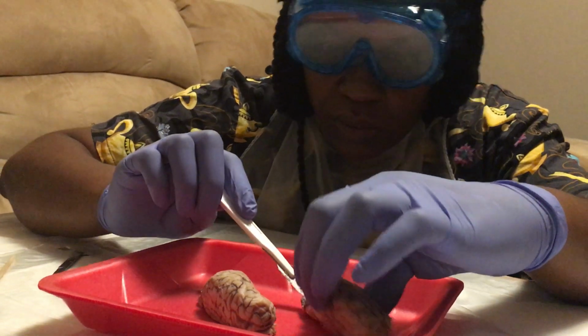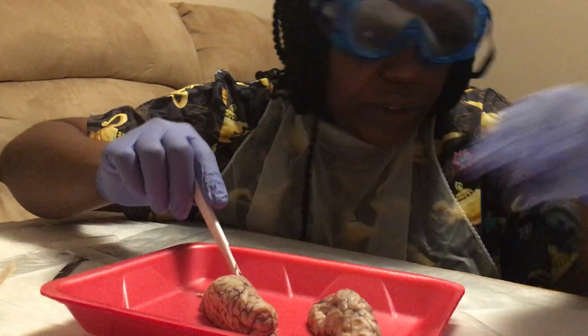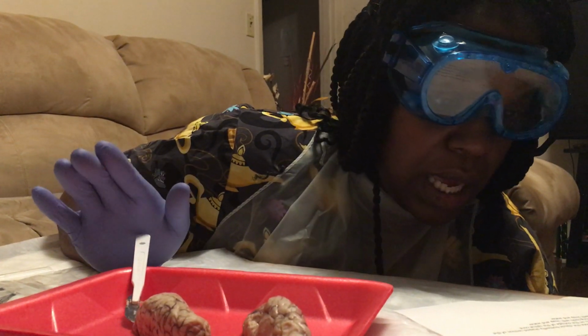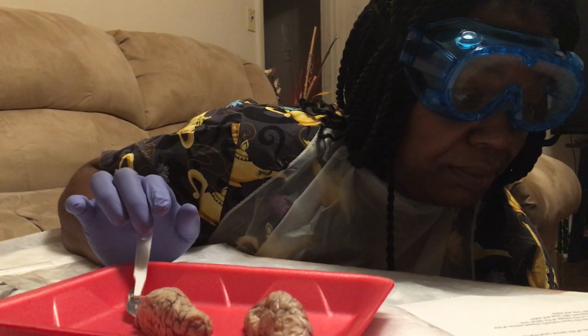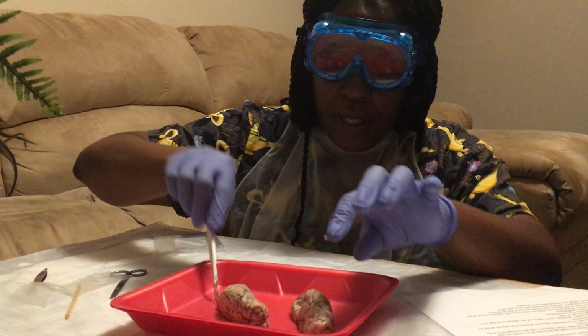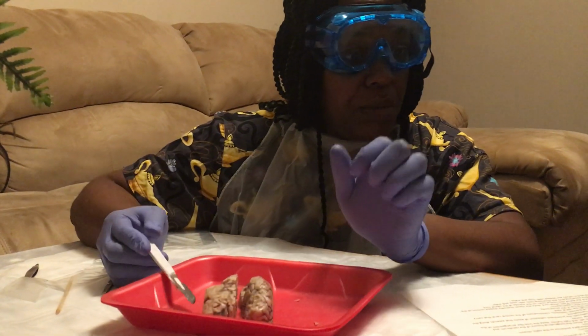I'm going to do both sides because I'm not really sure. And I believe that's it. That's it. I've named everything that I believe I was supposed to.